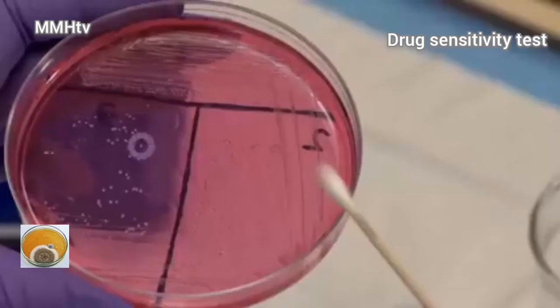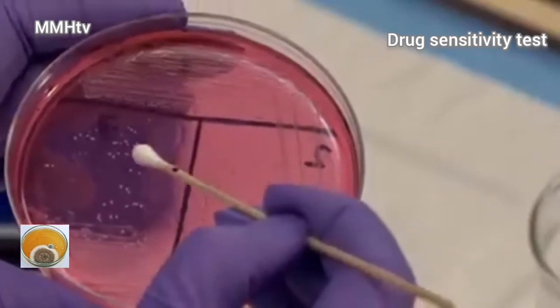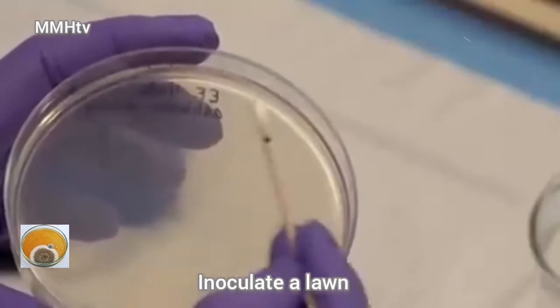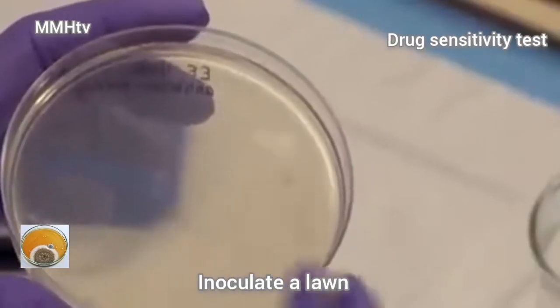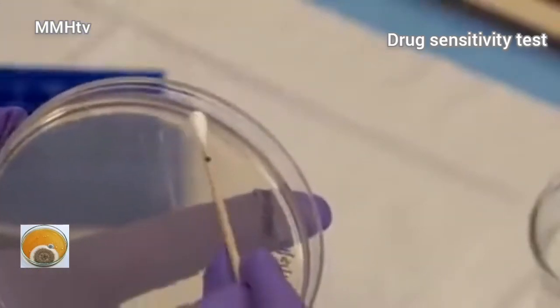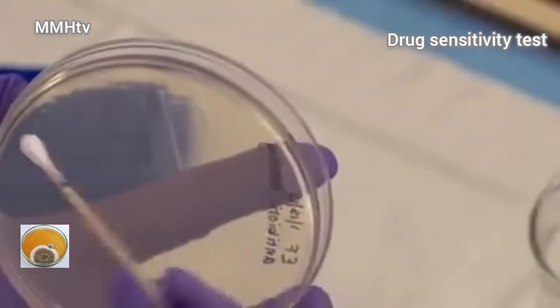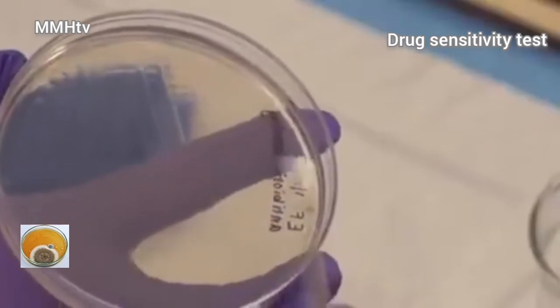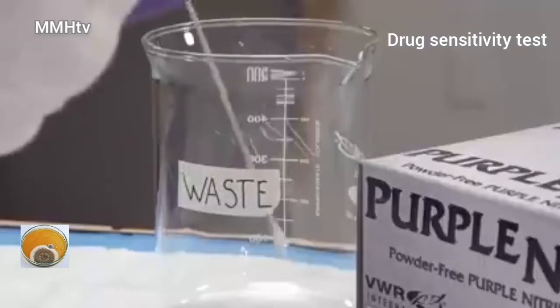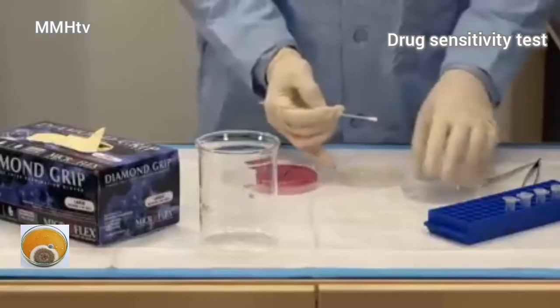Take a single colony of the bacteria, with the black dot facing you. Inoculate it on the blank plate by spreading the bacteria evenly. You can spread the bacteria again in the perpendicular direction. Discard the used swab in a waste container.